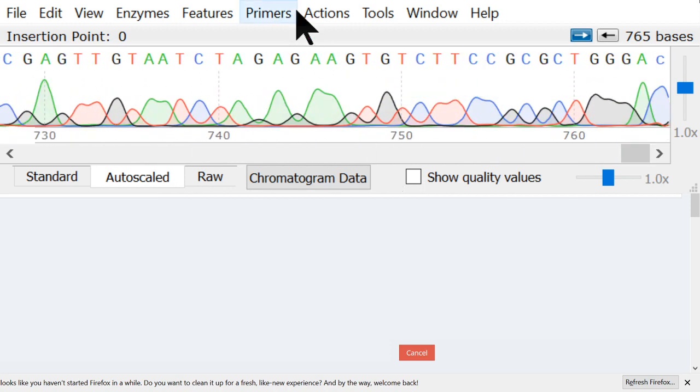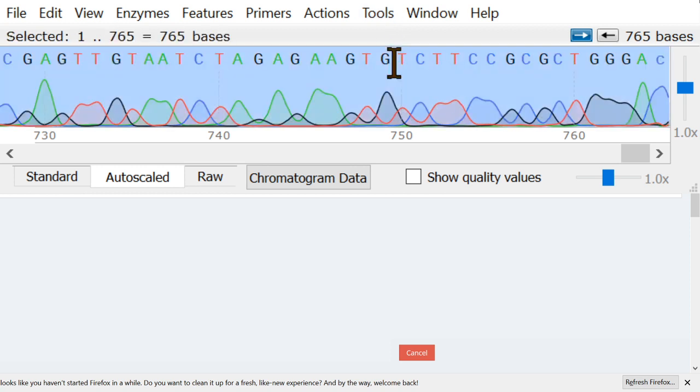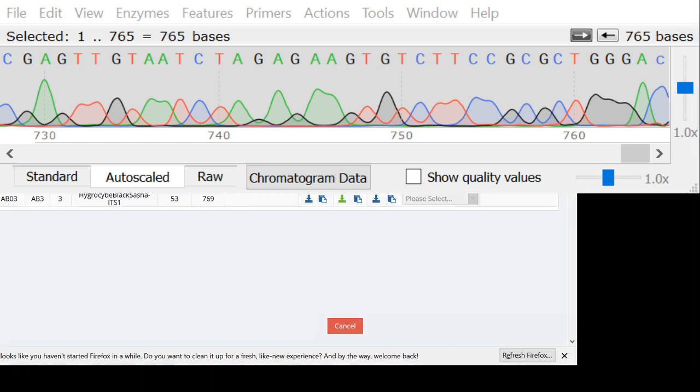So the next thing to do is to check this data, and the way I check it is I compare it with all of the closest matches in GenBank. So I'm going to select all and put it on the clipboard, and then we will open up Firefox and see if this works here. I think we want to put this in the background.